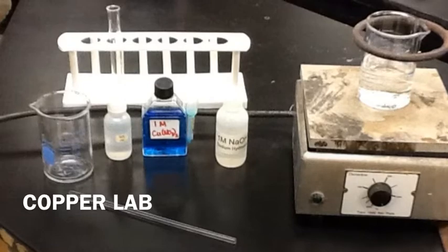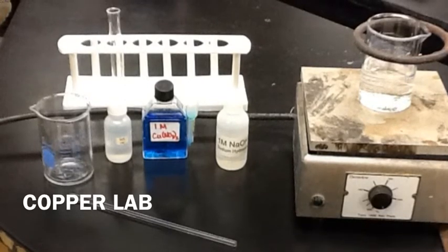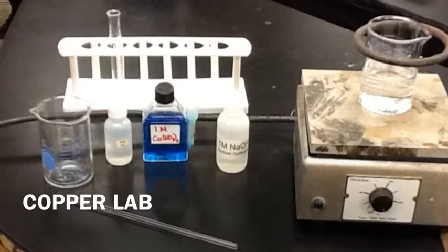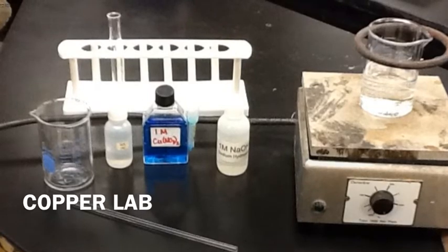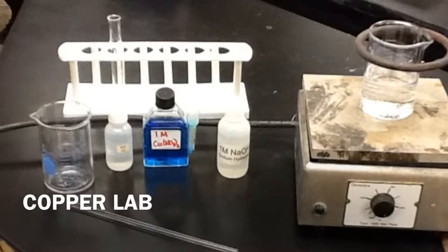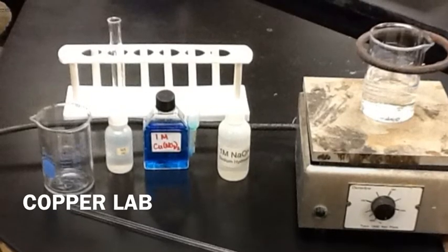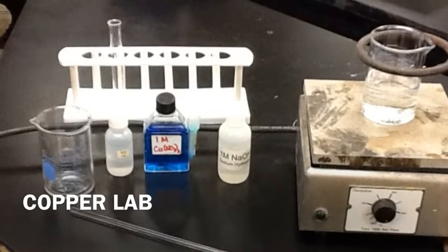either a Bunsen burner with a ring stand or a hot plate with a ring stand, and another 150 milliliter beaker that's filled about halfway with distilled water. You'll need to go ahead and turn that on right away so that it's ready for reaction number 2. You're also going to need 3 chemicals, and we'll look at those, and you should observe their physical properties.